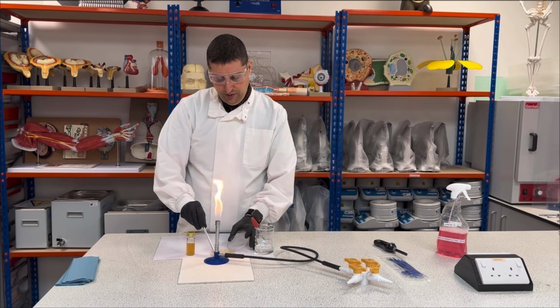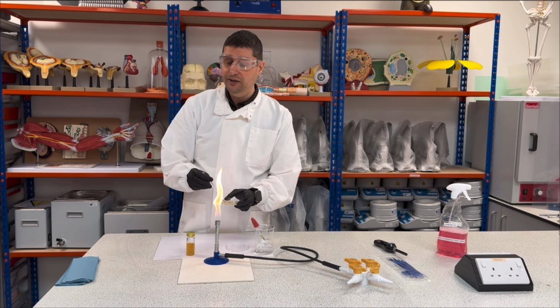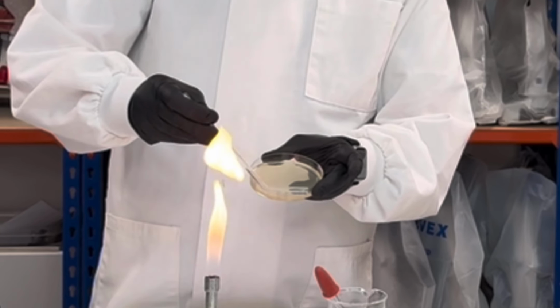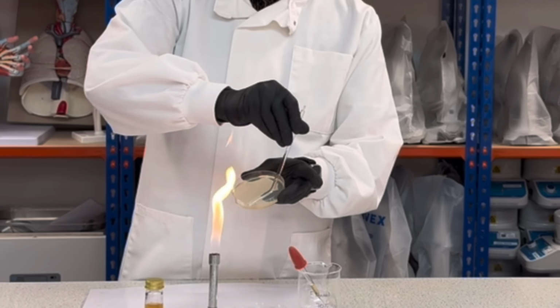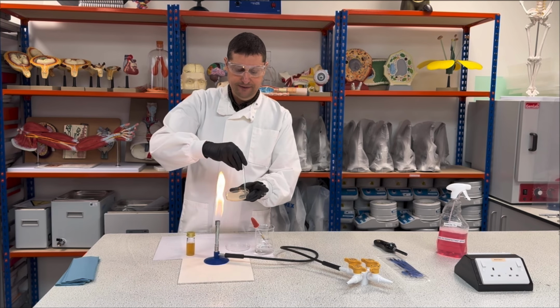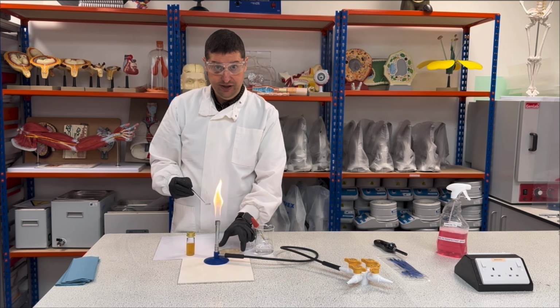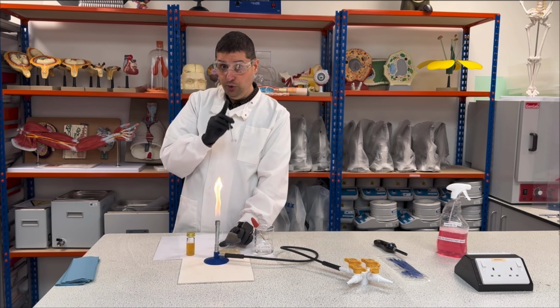Okay? How are you gonna do it? I'm gonna show something that's not right, but just for demonstration. So that's the movement you're gonna do. Spread everywhere. Okay? So spread everywhere. But when you're doing it, it's better if you do it here with the cover in the top facing you.